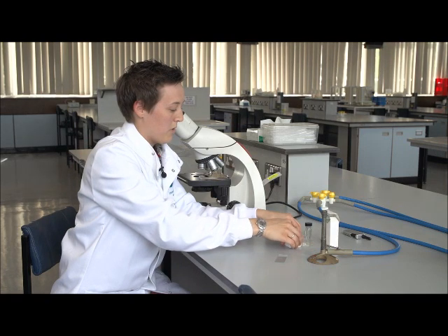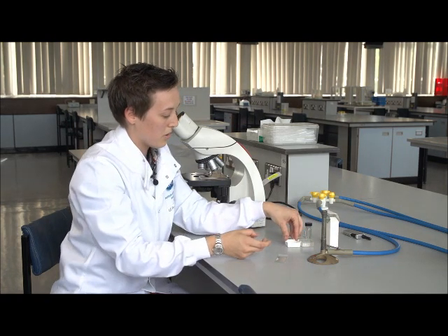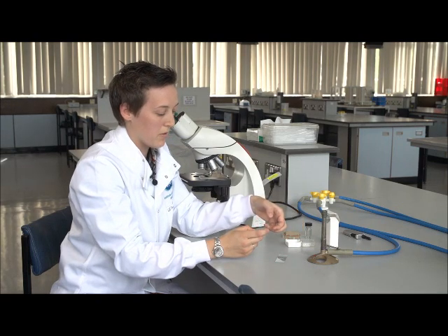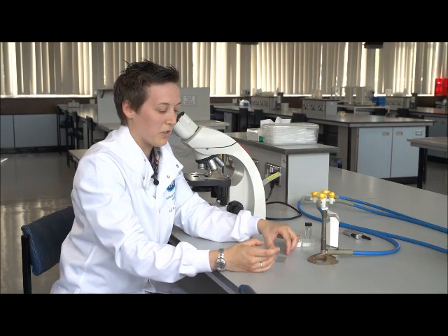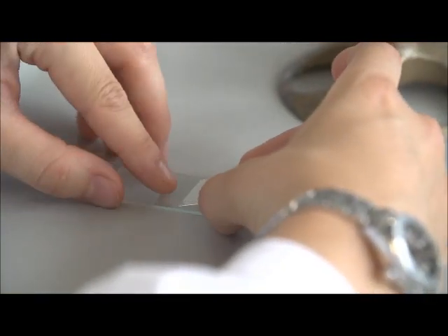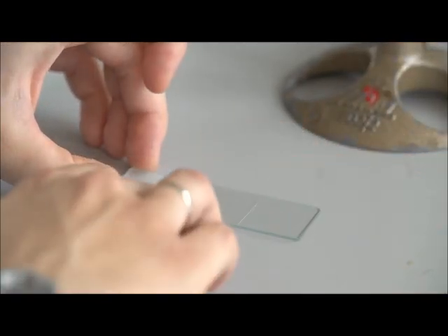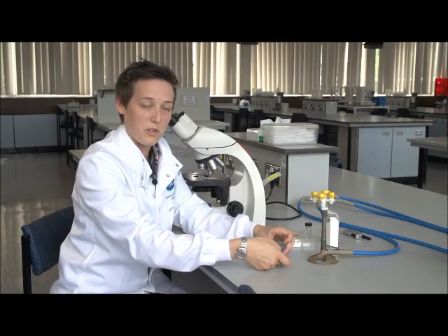And the last thing to do is just to pop a cover slip on top. Try not to touch the middle of the cover slip. We want no fingerprints on it, so hold the edge of the cover slip, put it down one edge first, and then drop the cover slip. And the water will spread and hold the cover slip on the slide.